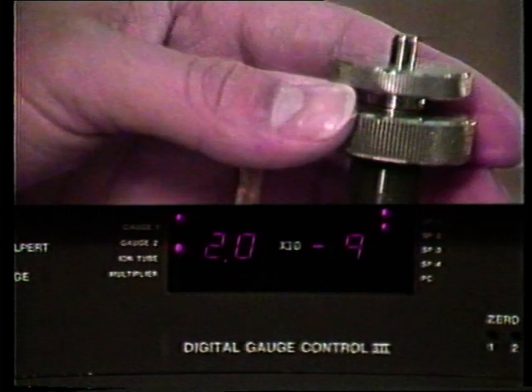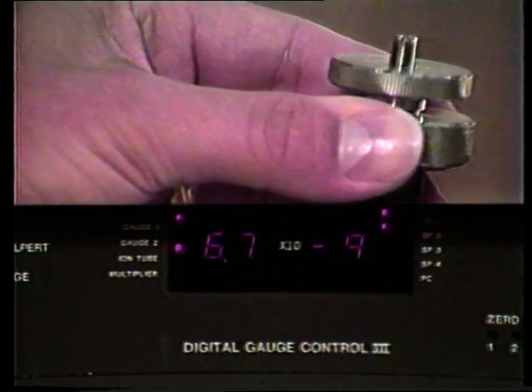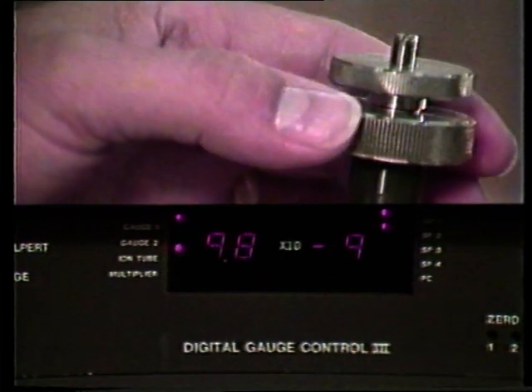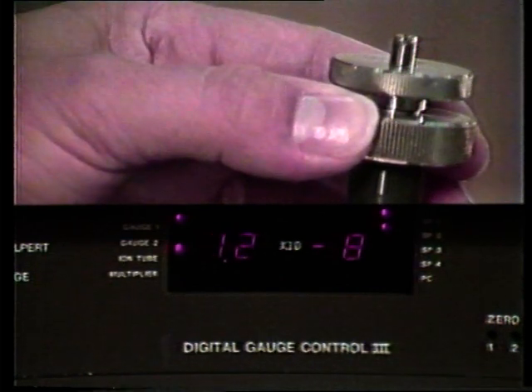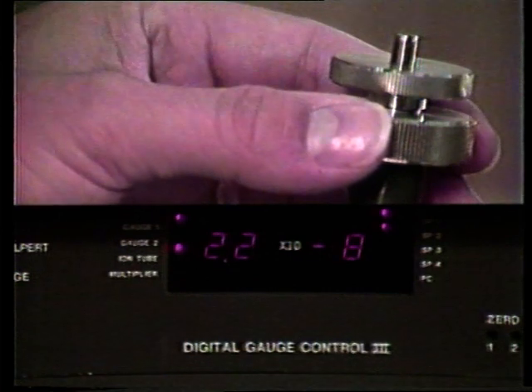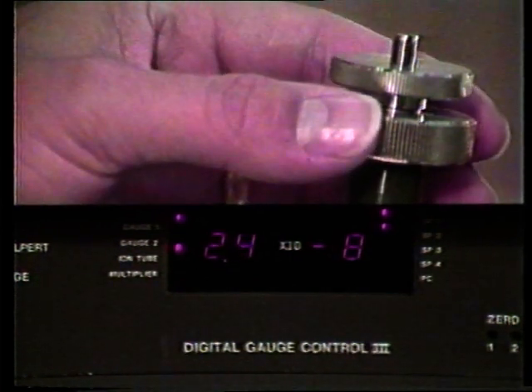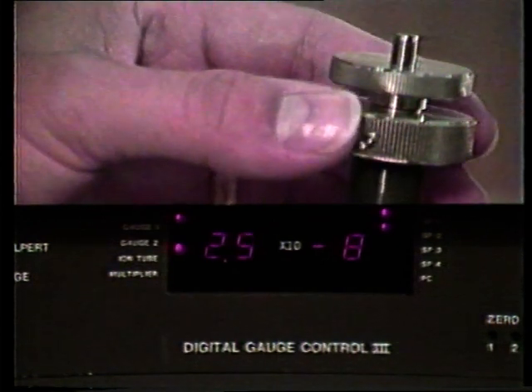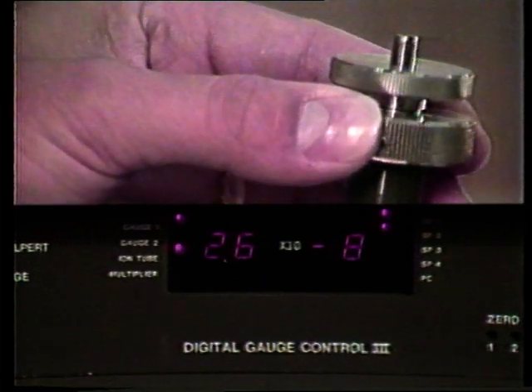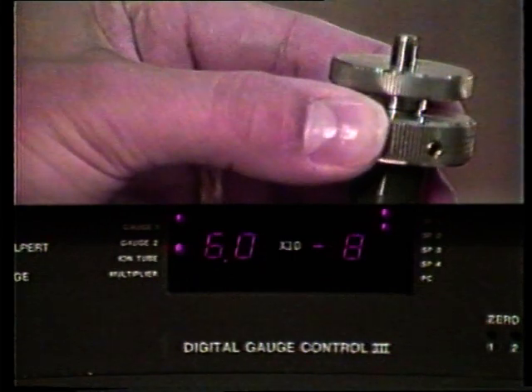Since we have a thermal valve control, to set up for the thermal valve control, we want to admit gas to an order of magnitude higher than the pressure at which we will be sputtering. Most of our sputtering, because we are differentially pumping the ion gun with the turbo pump, will occur around low 10 to the minus 8 range. So to set up the thermal valve control, we want to be an order of magnitude higher.